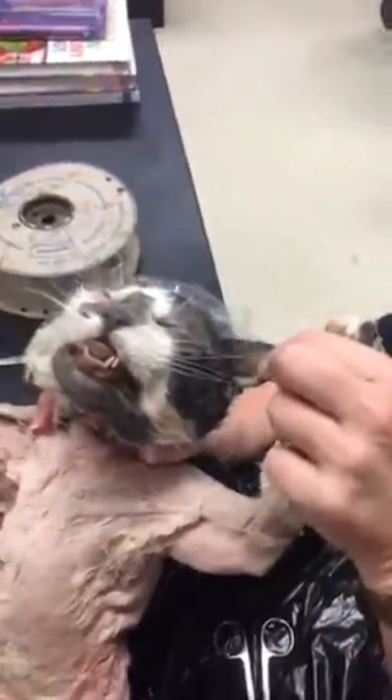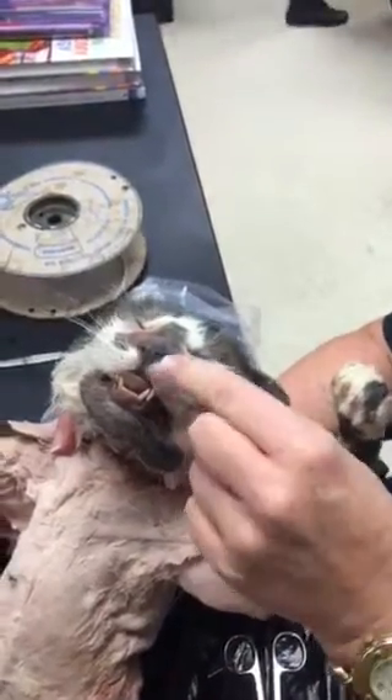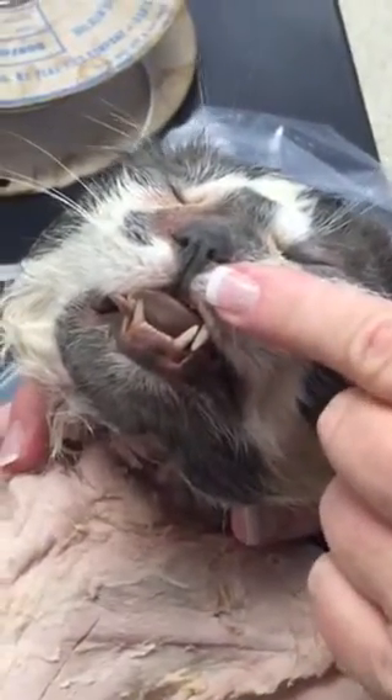On the head, the ears are called pinna. The whiskers are called vibrissae. The nares are the nostrils, and then the cleft in between is the philtrum.